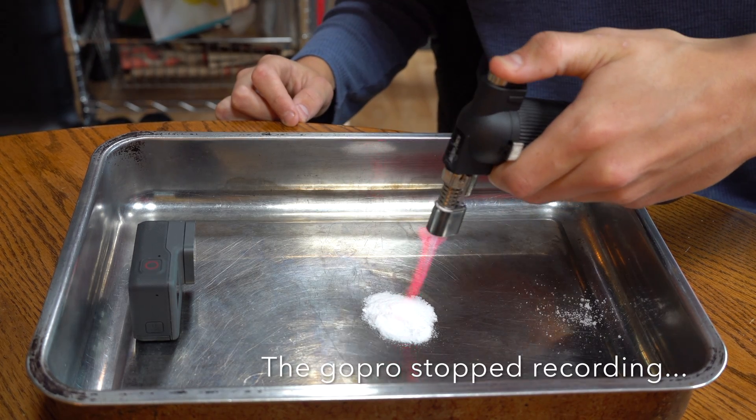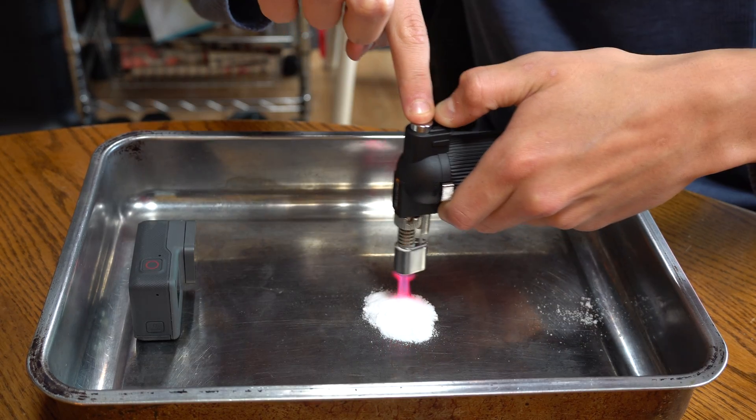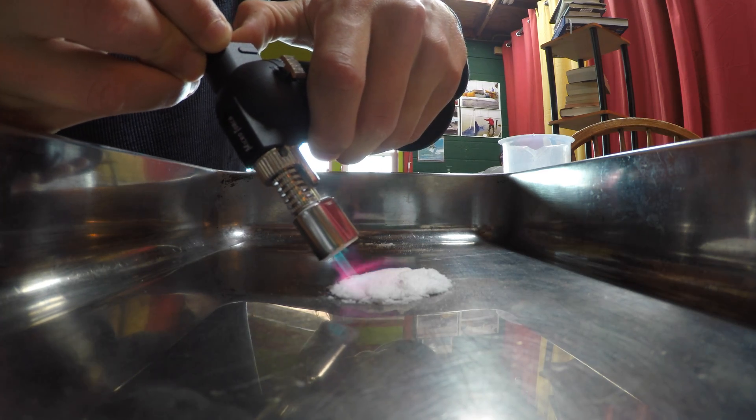See the flame! Isn't that so cool? Look at that — boom!